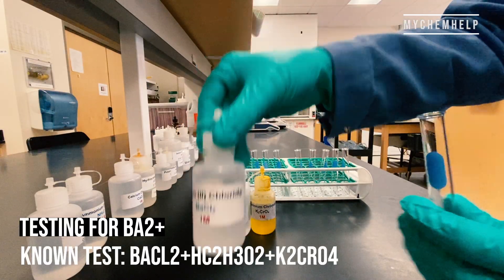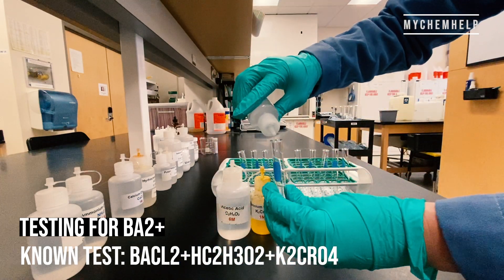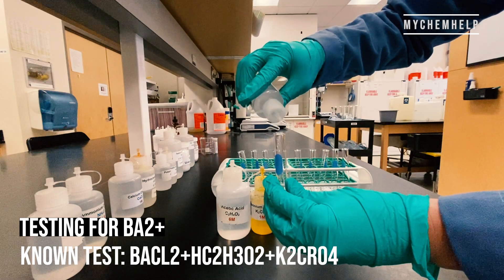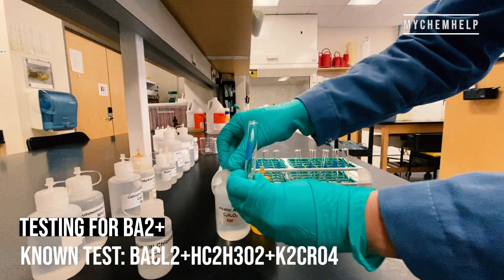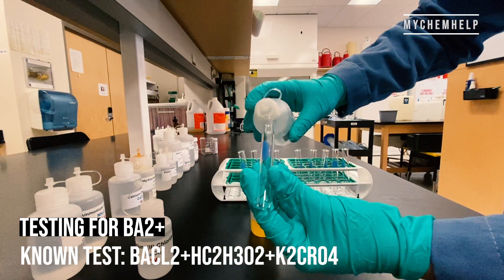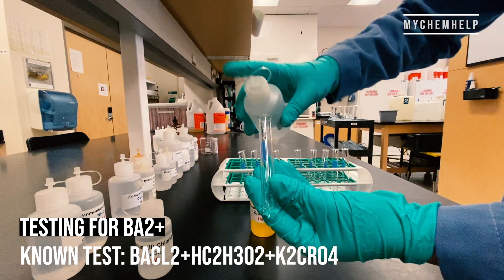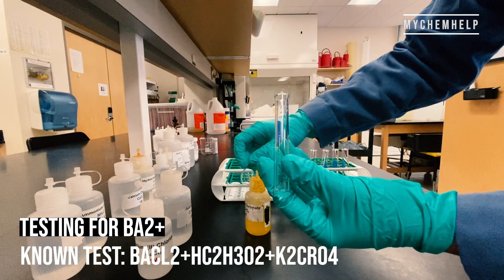The first one I'm going to test for is barium 2+ ions. I'm going to put a few drops of barium chloride inside the test tube, followed by acetic acid, and lastly potassium chromate.